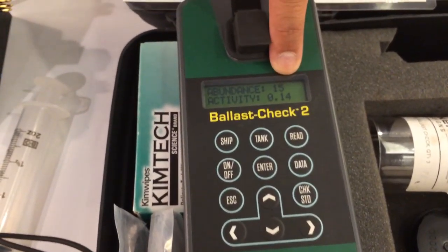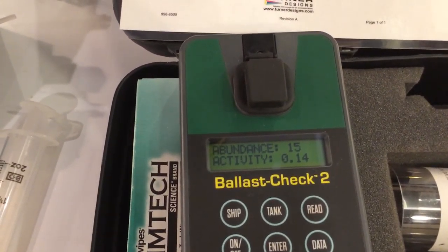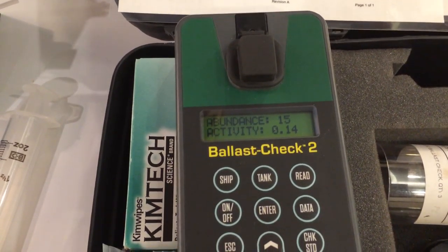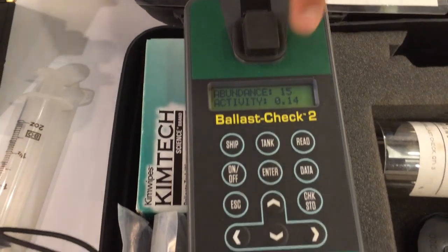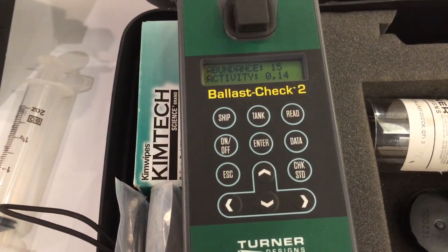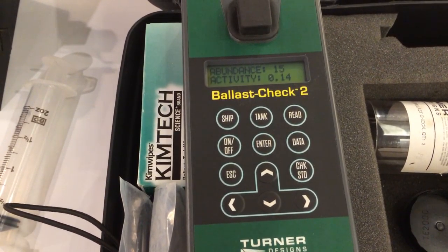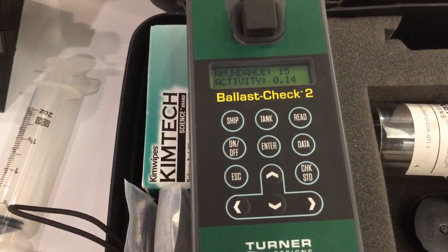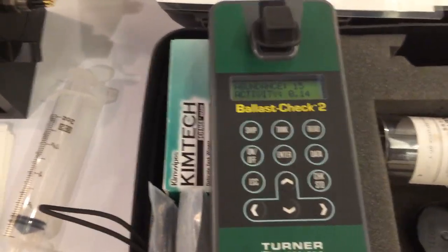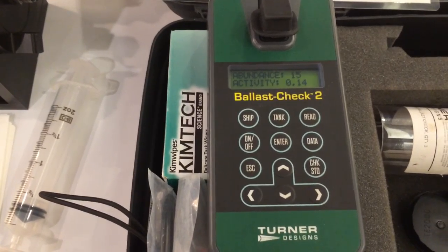I have 15 cells per milliliter. Now that's above the regulation — the regulation has to be less than 10 and I have 15. But look at my activity: it's 0.14, very low. The cells in this sample are very low activity. So it's doing the total count of the individual cells, but then the activity is related to how photosynthetically active the cells are.